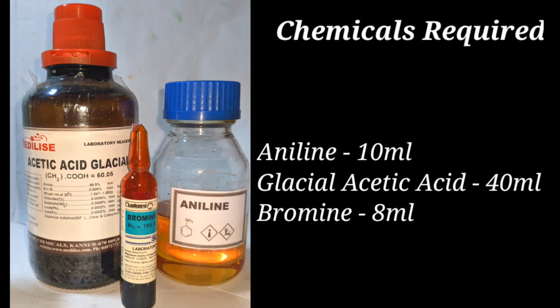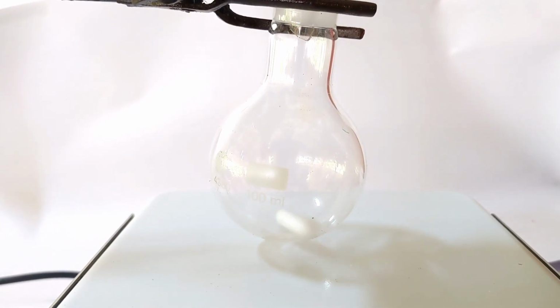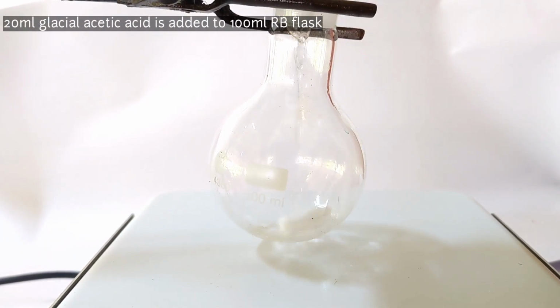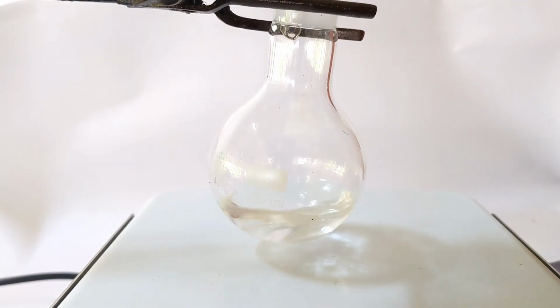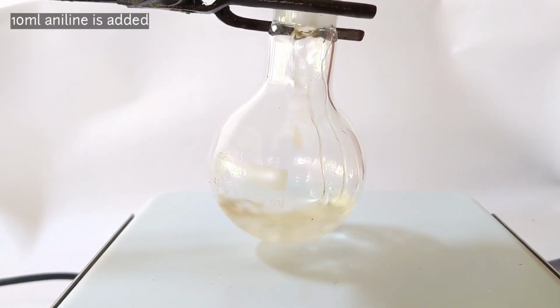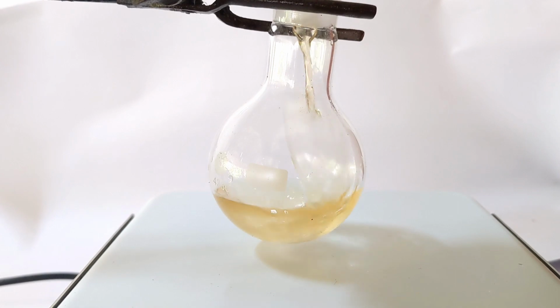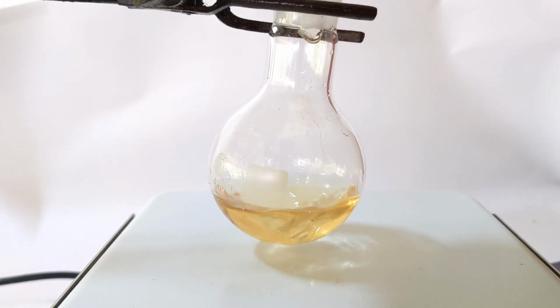bromine. A 100 ml round bottom flask was attached on a clamp over a magnetic stirrer with a stirring bar inside. With continuous stirring, add 20 ml of glacial acetic acid to the flask. Now add 10 ml of aniline to the flask. Aniline dissolves in glacial acetic acid to form a uniform mixture. Now keep the flask aside.